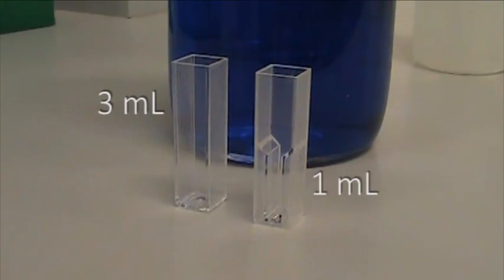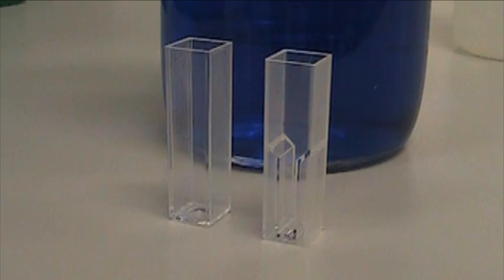The Shimadzu spectrophotometer takes square cuvettes that hold either 3 mils or 1 mil of solution.